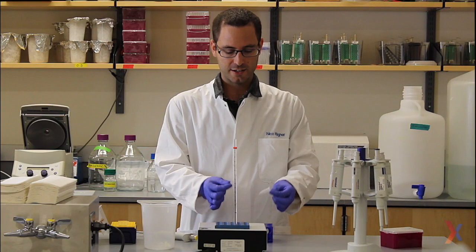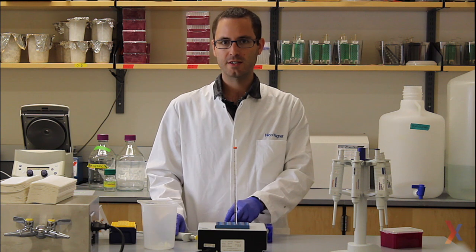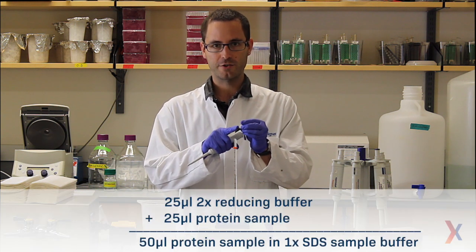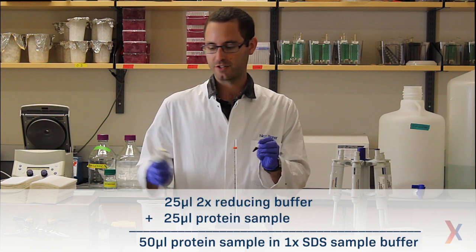I have isolated 25 microliters of four different protein samples. I have a 2X reducing buffer, which means I need to add 25 microliters of this into each of my four samples.